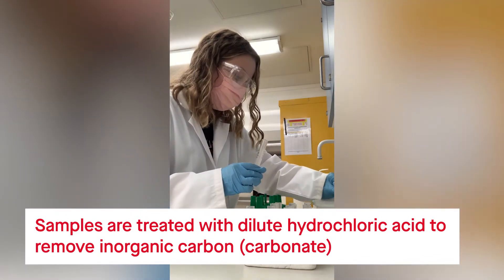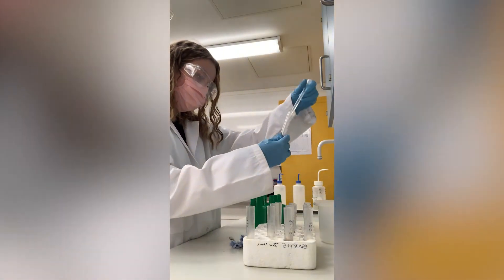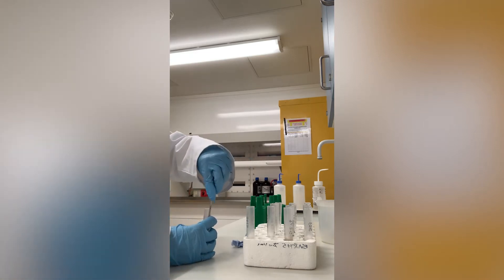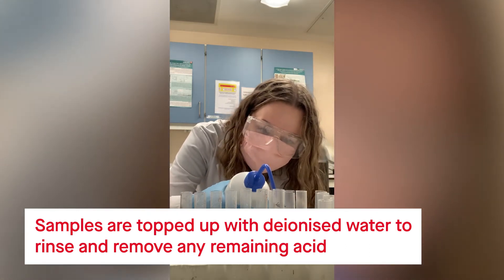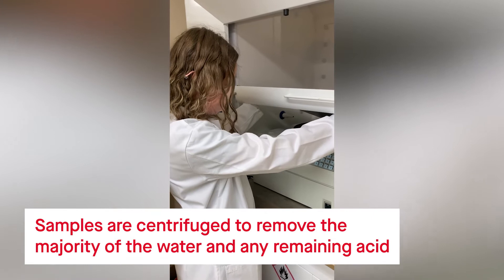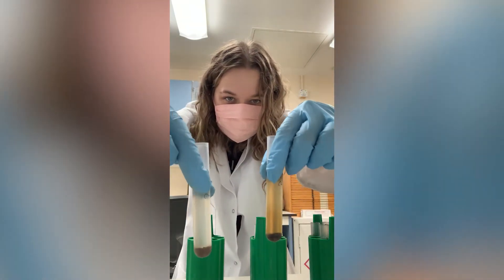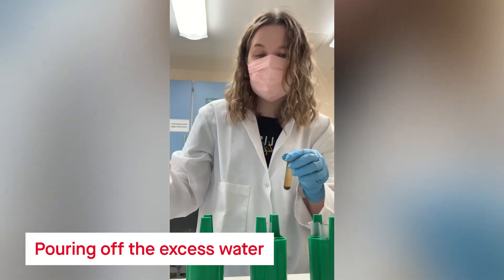And now for one of my favourite bits of the day, practical time in the lab. So now we've got the samples out of the centrifuge, and you'll be able to see that there is quite a variation in the colour and the liquid, and that signifies how much organic carbon is in the samples. What we need to do is get rid of the excess liquid and then we're ready to carry on with the process.